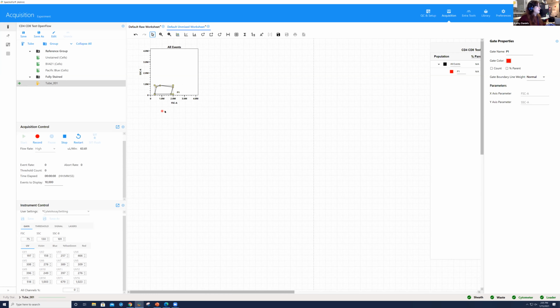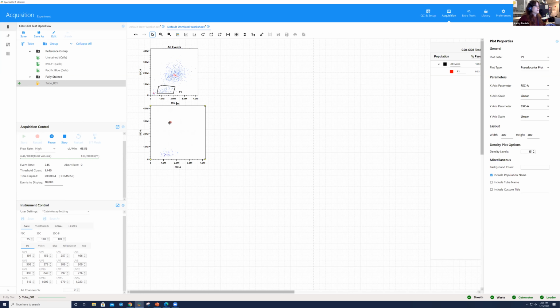So I have the cells that are just loaded up. I'm going to start recording as soon as I see it, and then we're going to set the gates as we're going. So I'm going to start recording. Okay. If I double click on this P1 gate, which is my scatter gate, we can then create our second gate and create a parental gating strategy.